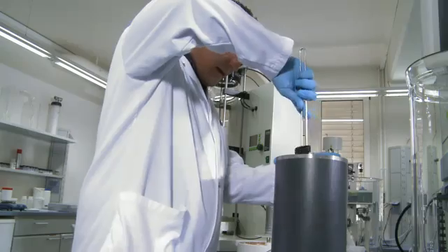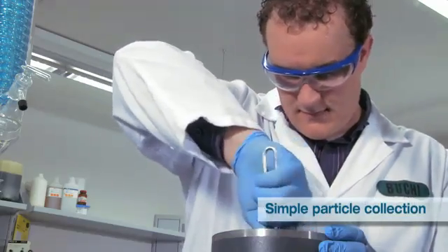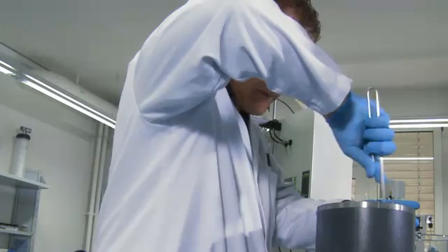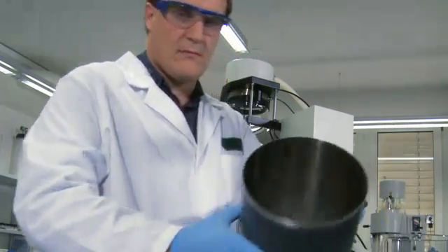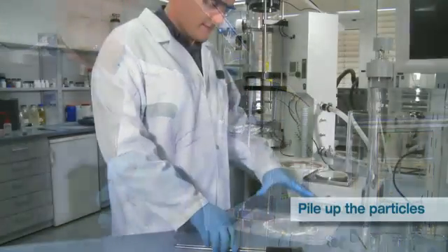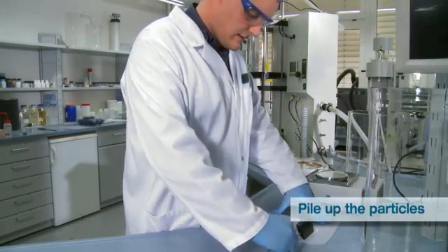Scrape the particles from the inner wall of the collection tube by using the particle scraper. Notice that the collection tube must have reached room temperature before doing this. Pile the particles together on the collection paper with the scraper.